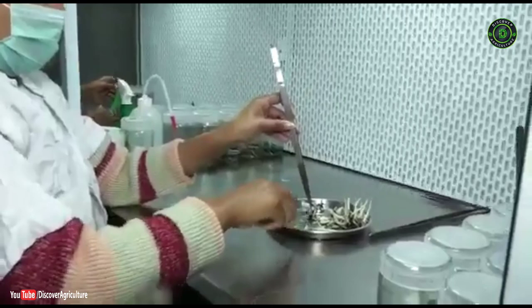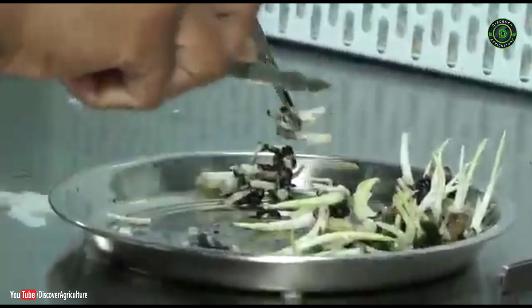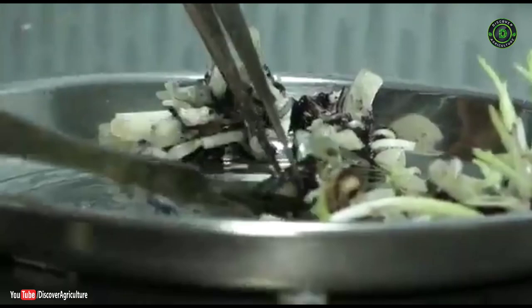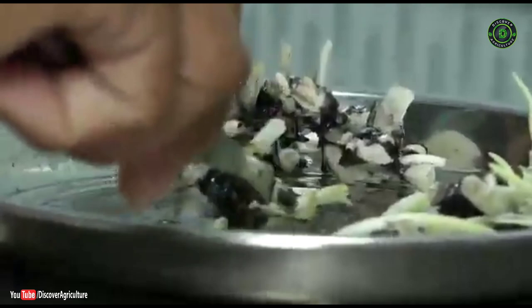Successfully initiated cultures are further utilized for multiplication. The first subculture is done after 20–25 days of initiation when the explants turn green in color. Cultures are first checked for contamination — fungal contamination symptoms appear within 1 week, and bacterial contamination symptoms such as change of medium texture or visible colonies appear within 1 week to 1 month. For subculturing, the outer dead tissue from the base of the explant is removed and 1 or 2 leaf bases are peeled until fresh meristematic tips are exposed.